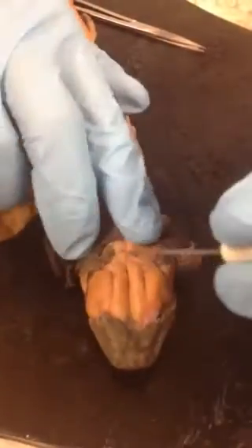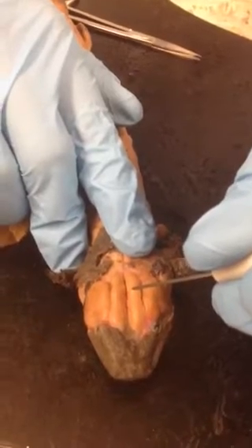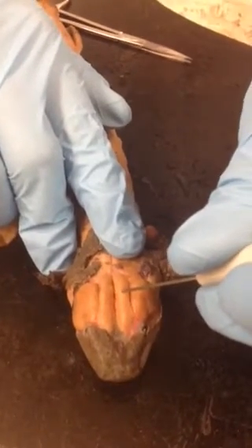We're going to start with the head. You guys ready? Everybody good? Okay, let's do this.